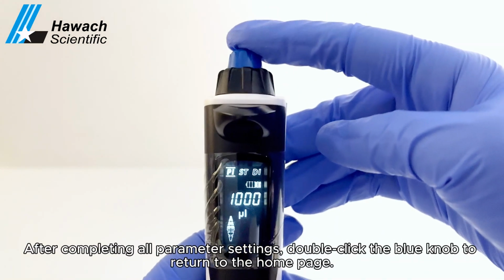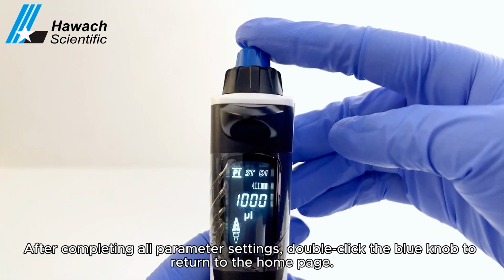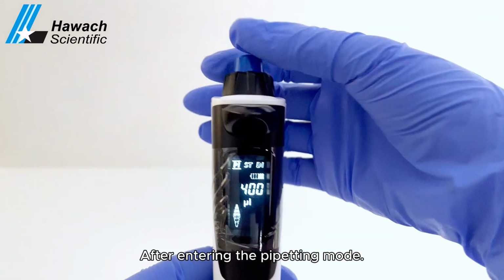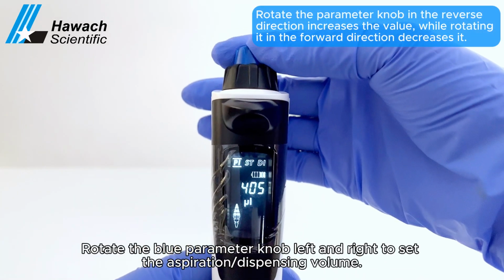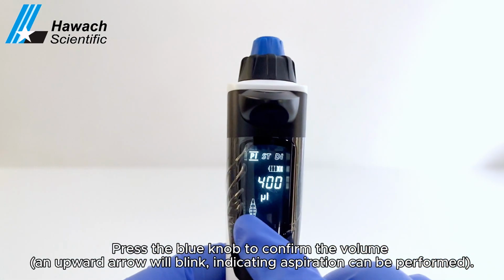After completing all parameter settings, double-click the blue knob to return to the home page. Pipetting mode. After entering the pipetting mode, rotate the blue parameter knob left and right to set the aspiration, dispensing volume. Press the blue knob to confirm the volume.